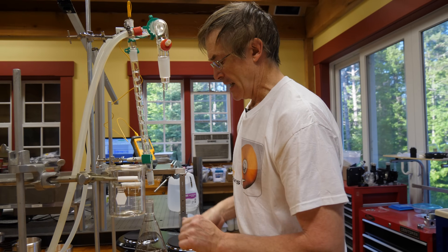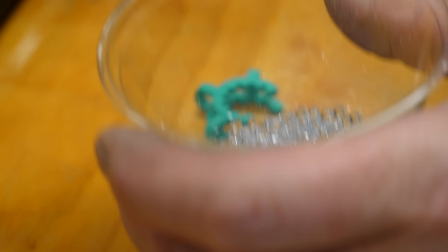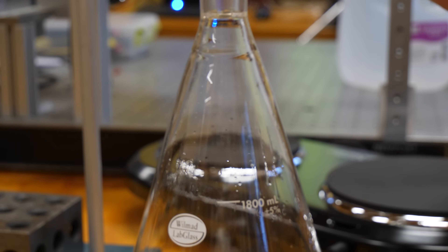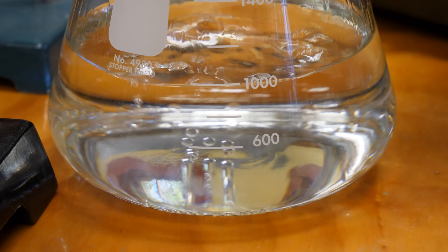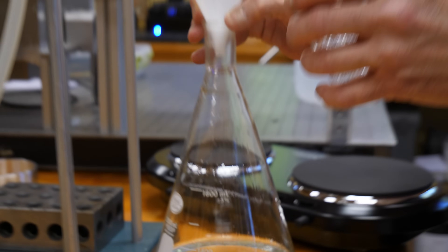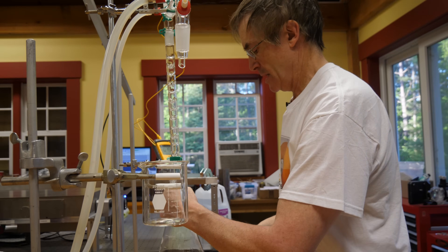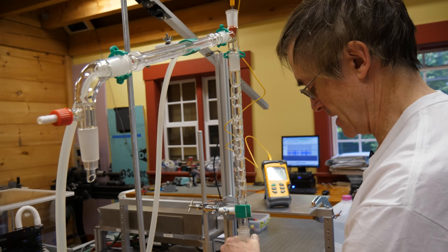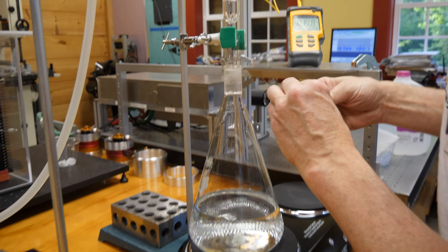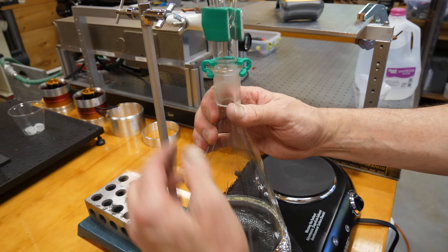I'm also going to add a small quantity of what are called boiling beads — these are Pyrex reusable glass beads. We're going to put them in the boiling flask to increase the surface area on the bottom, which helps augment the rate of boiling. You don't need a lot of these, but they give more surface area for boiling bubbles to form on. Instead of getting large bubbles and spray thrown up against the sides, this improves the boiling rate and quality of the boiling process.